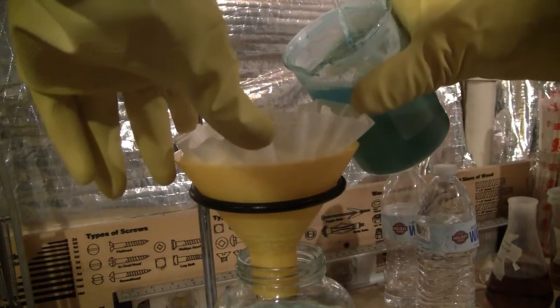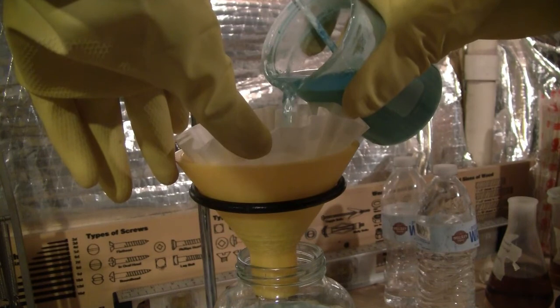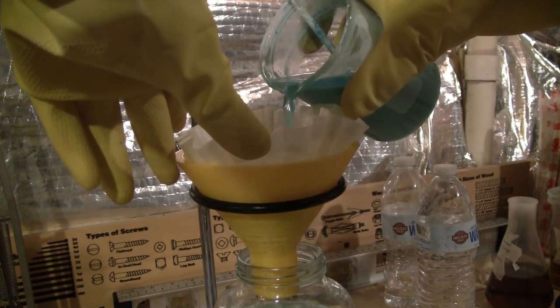After a few hours of reacting, the solution is then gravity filtered and washed with some water to remove any copper sulfate, sodium carbonate, and sodium sulfate.